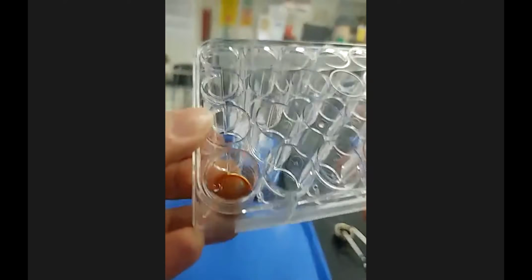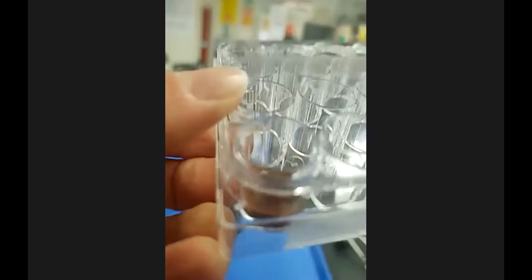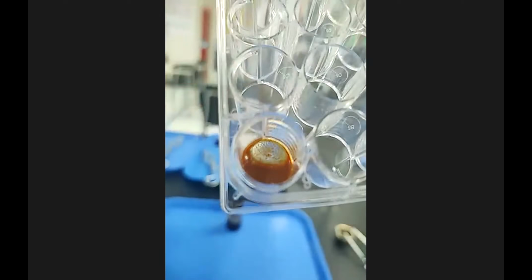But from the side, whenever you're viewing a mixture of solutions, it's good to view it from all angles, not just what most students do, which is they just look at it from this view, okay? And you miss some of the detail. And if I also move it, you can see that there is a residue there.